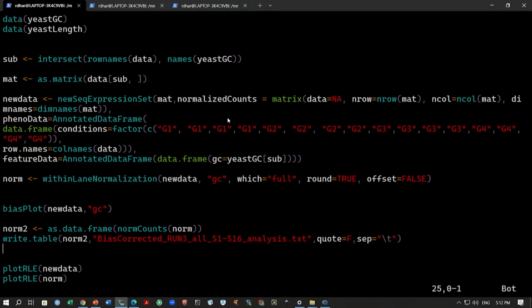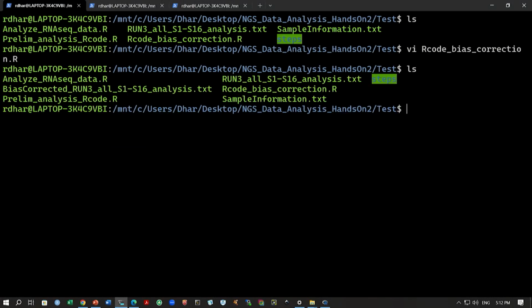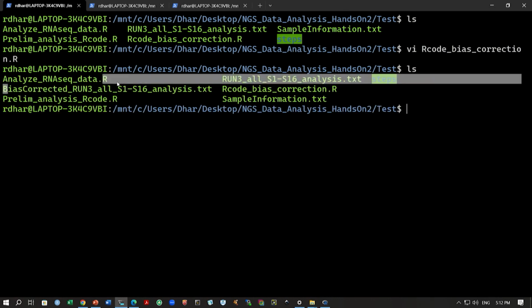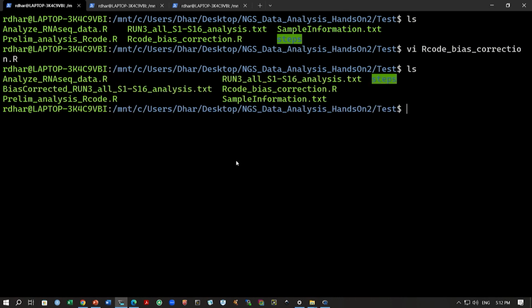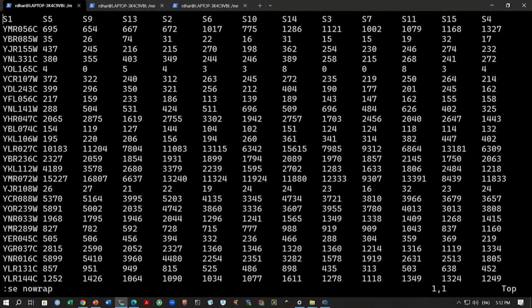One final thing we want to see is that we have created the bias corrected file. So this code is complete now. We have run this code. We can come out, and we just want to see that we have created this bias corrected file. So here is the bias corrected file. We can open this with VI, just to see again that we have created this file and saved it in the right format. Because we will load this data next when we do the differential gene expression analysis.